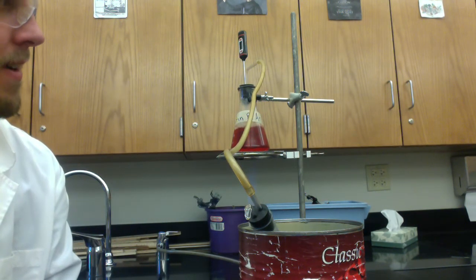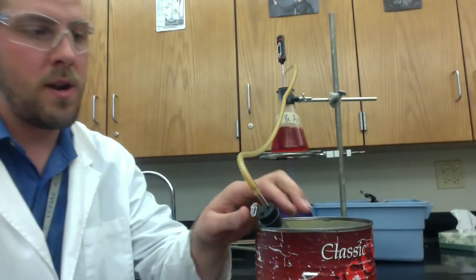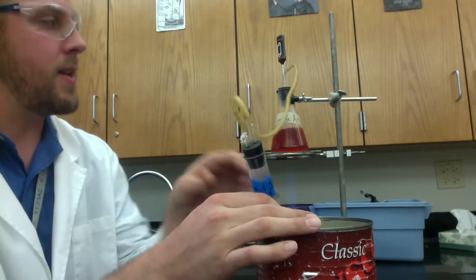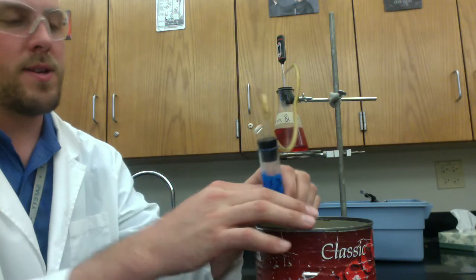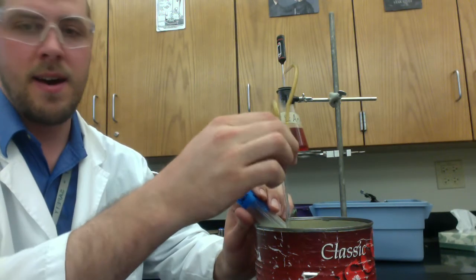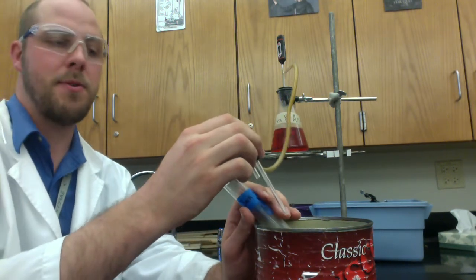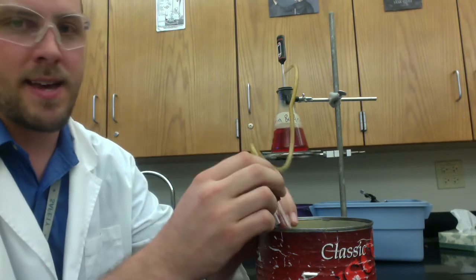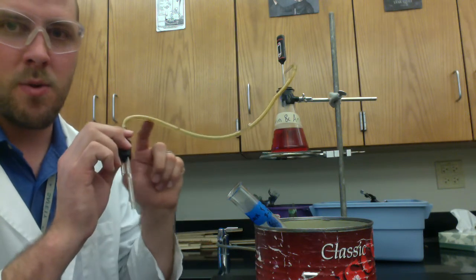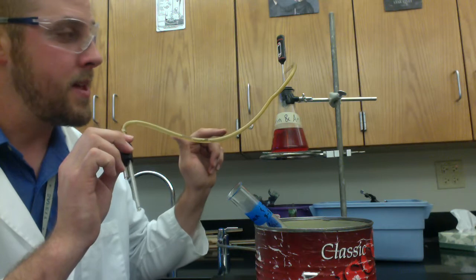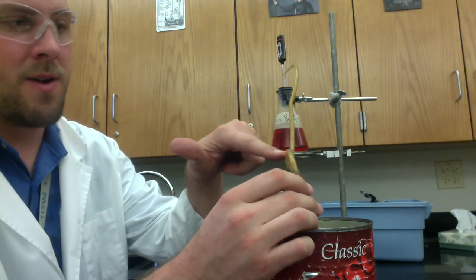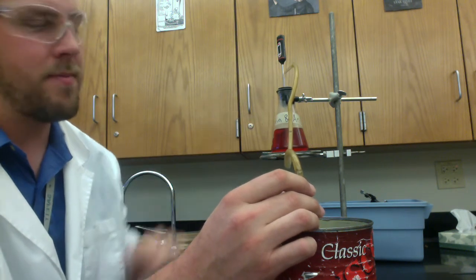One thing to be really careful with, I know I'm telling you a lot of things to be careful with. You really don't want to submerge your test tube at all. And then once you turn this experiment off, so I'm going to turn this off prematurely. Once that's off, you really want to be careful to disconnect this and not put it into your ice bath. I've had one or two people do that every year I've done this lab. And what's actually going to happen is as this gas is cooling down on here, it's going to condense and take up less space. It'll create a vacuum effect. You can already maybe see some of the water traveling back up this tubing. So it's fine for a little bit of that water to travel back up that tubing. But guess what? If you put it in here, all of a sudden it's going to start sucking all the water out of the ice bath. It's going to create a siphon and it's going to start traveling into that Erlenmeyer.